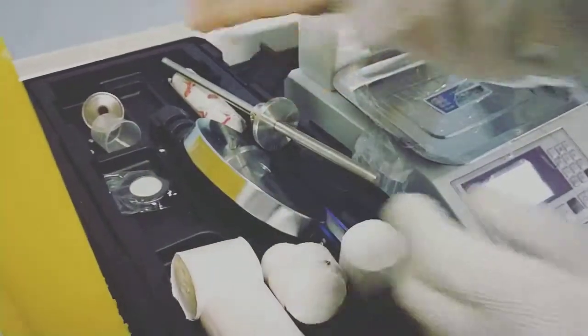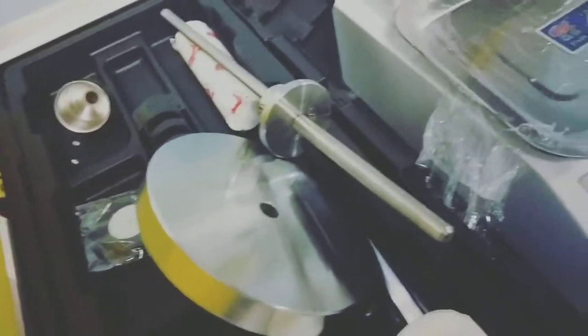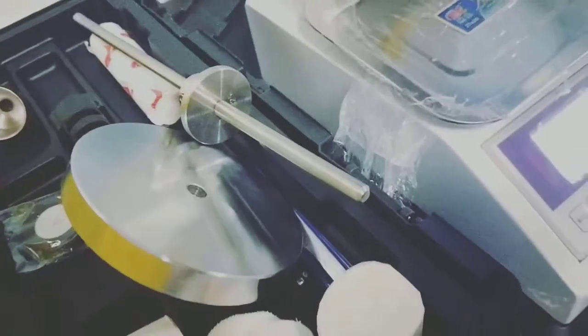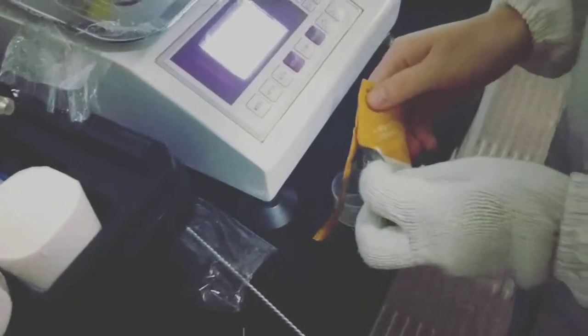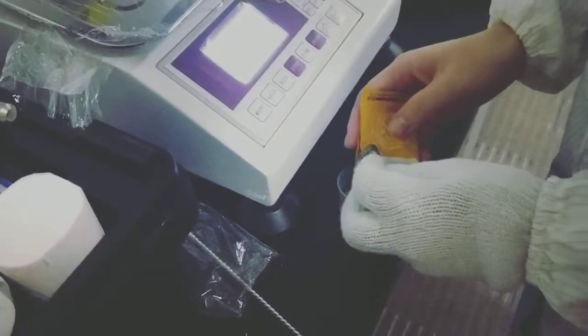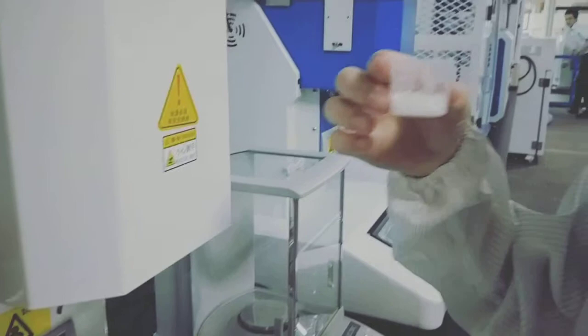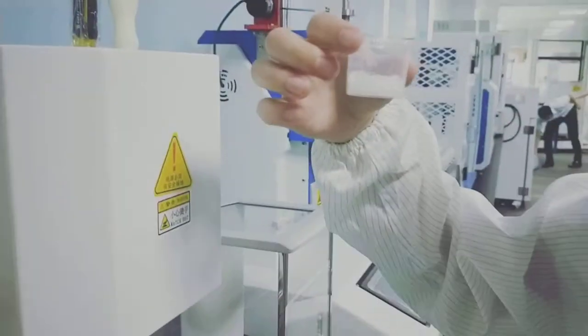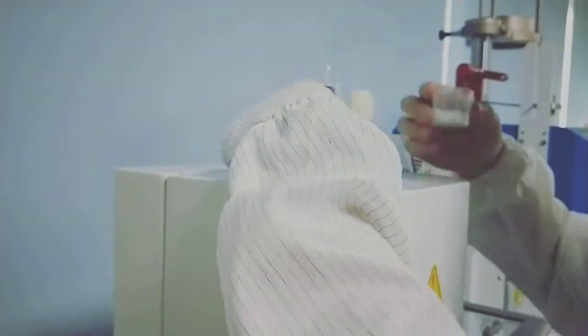Then we add sample into the hole. Normally we need about 7 to 8 grams each test. This is the sample each time we use, and use this one to add the sample into this hole.